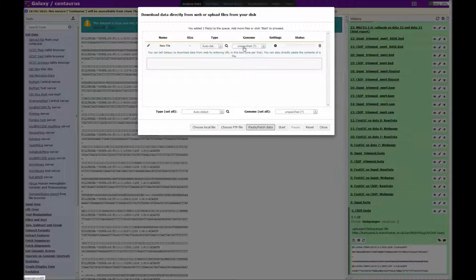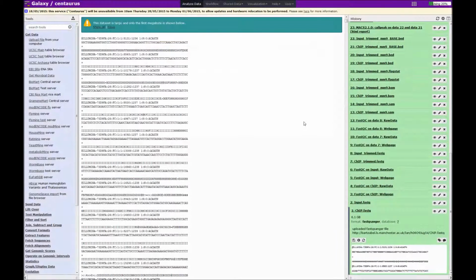There is a third option in that you can ask the administrator of the Galaxy instance to set up a data library for the information that you want to import, and this is accessible by going to the shared data area at the top of the screen and using the data libraries tab.